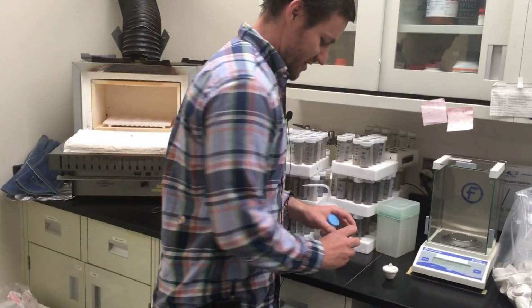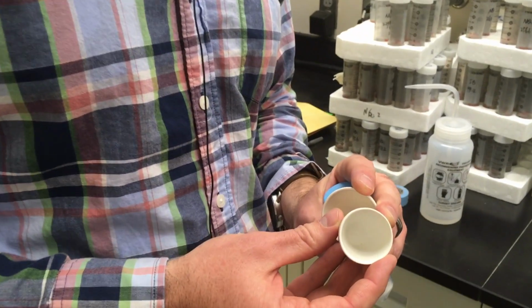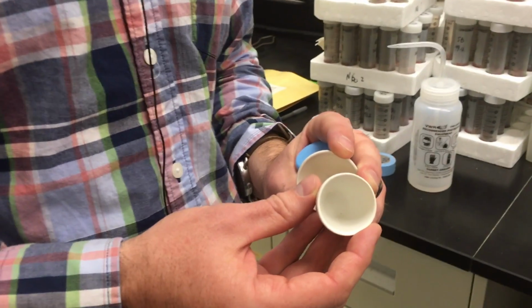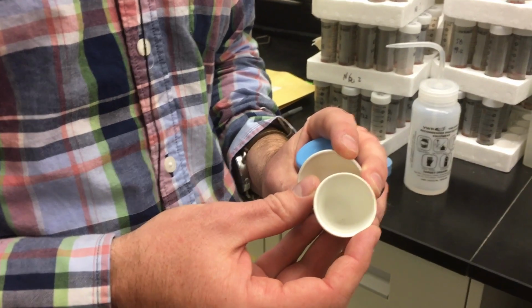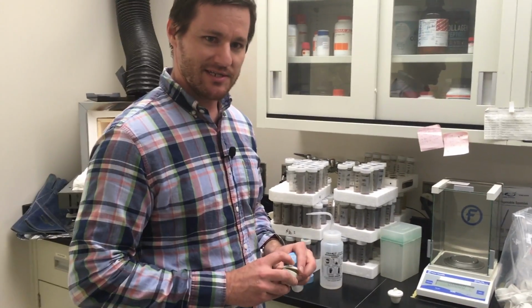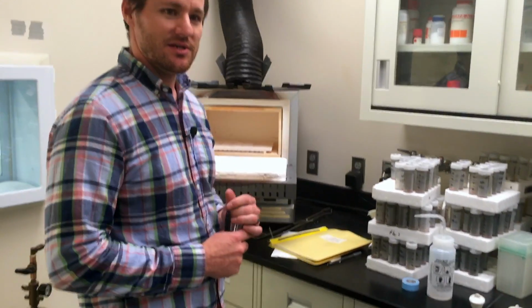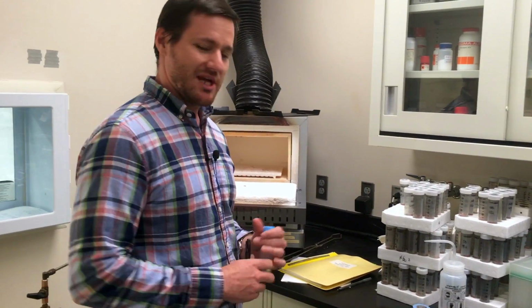In comparison, we have a somewhat not so good crucible, and if you look closely, you might not be able to see it in the camera, but the gloss is not there. And so there is a chance that you won't be able to get your sample out of it as easily.